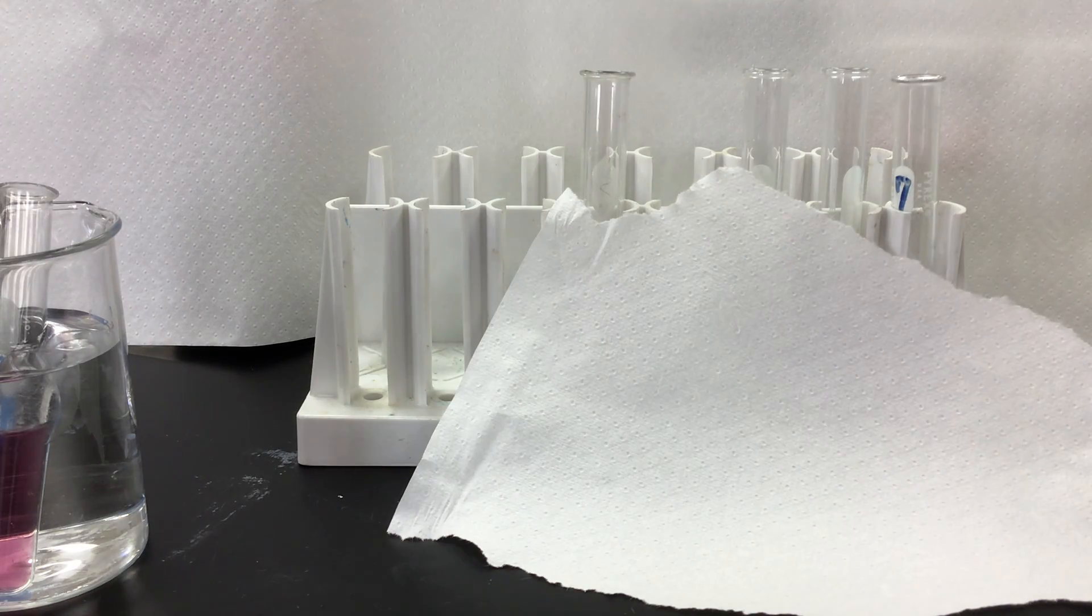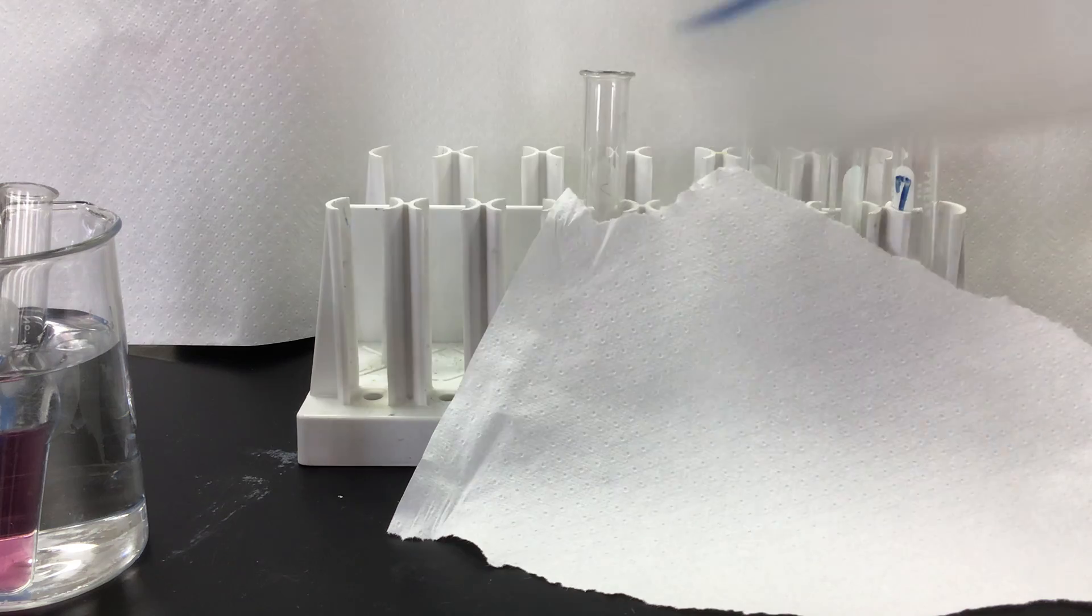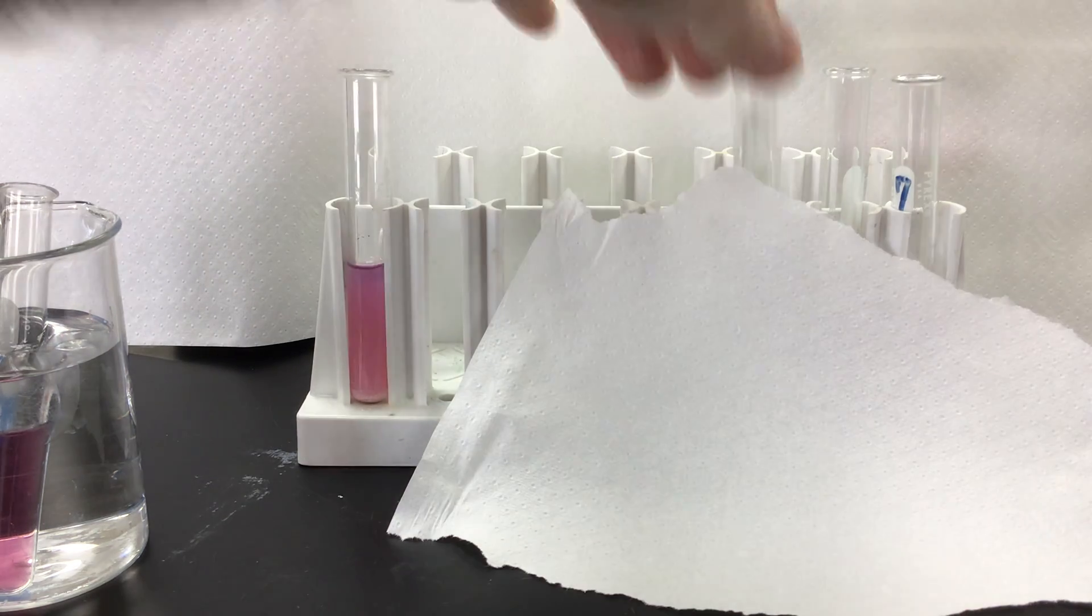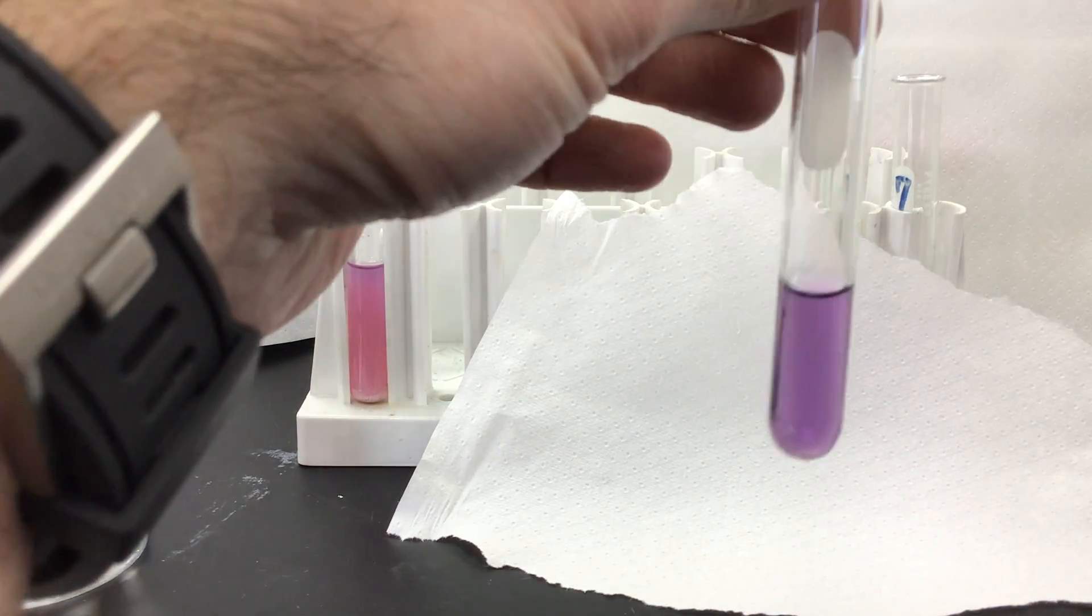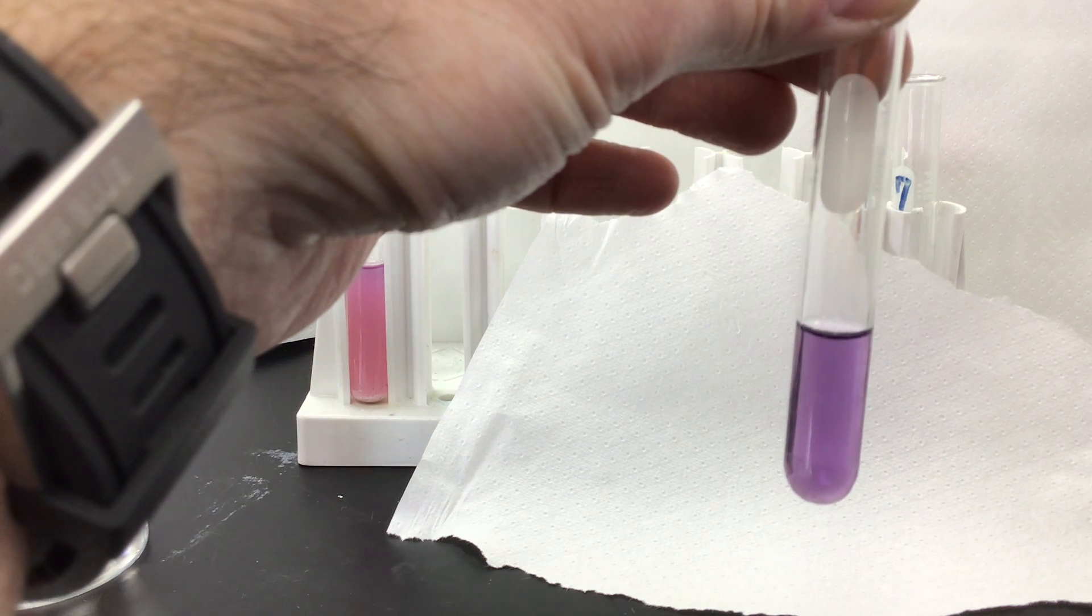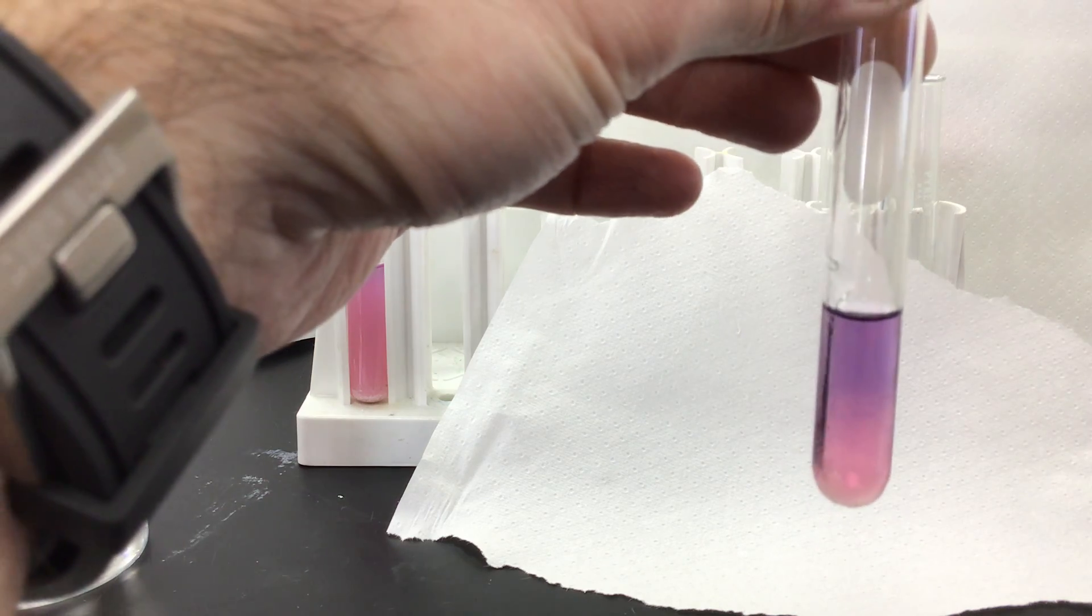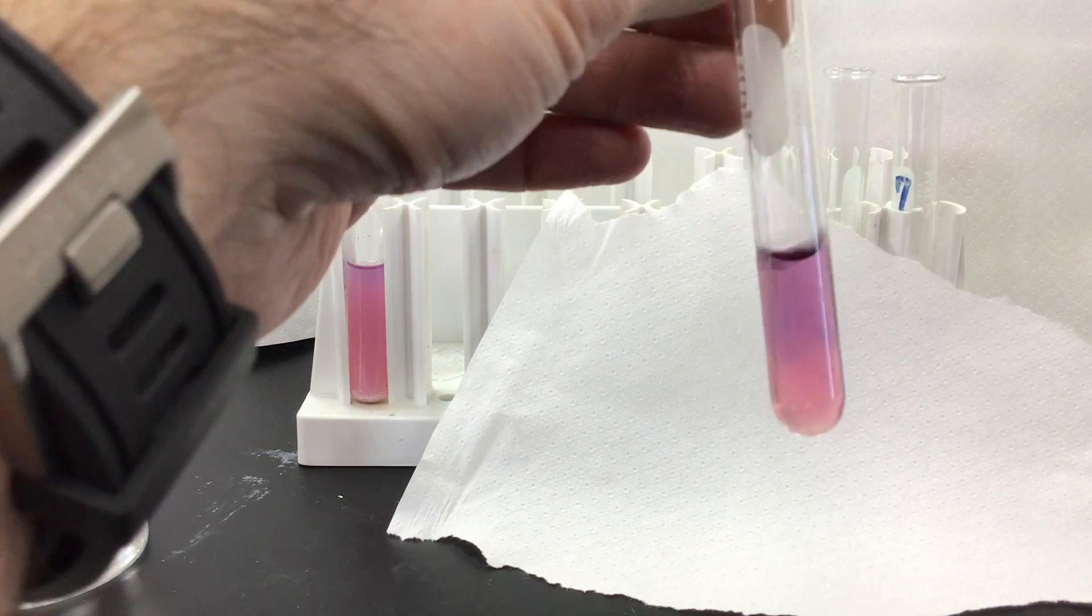Next one, we're going to add a little bit of water. I've just got a little squirt bottle of water and I've got another same solution here again, a purple solution, and we'll add a little bit of water to it.